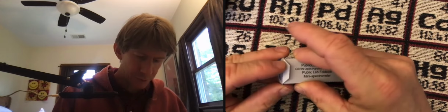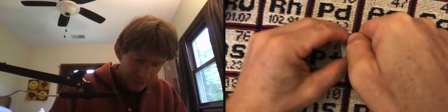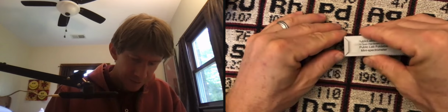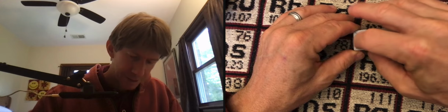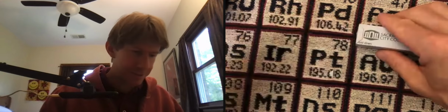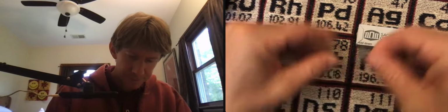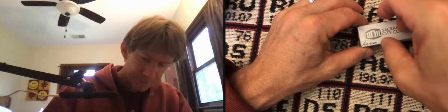So I've got that tape stuck down on that tab, and close it. I'm going to get it as good as I can there. And that actually isn't too bad. Same thing on these two sides. I'm going to tape it to the little thing there.